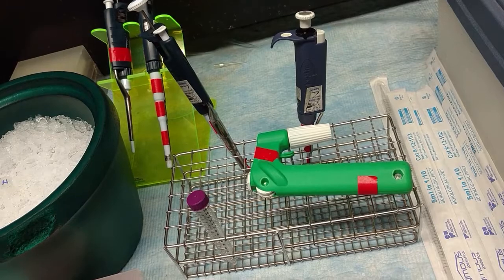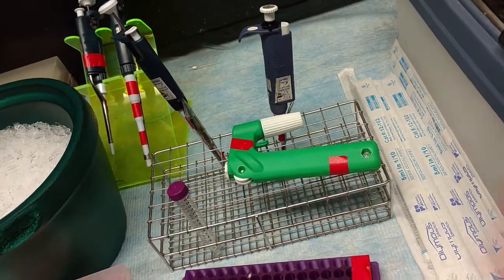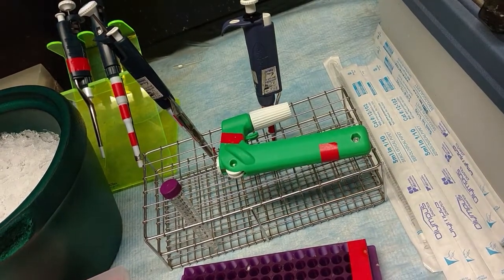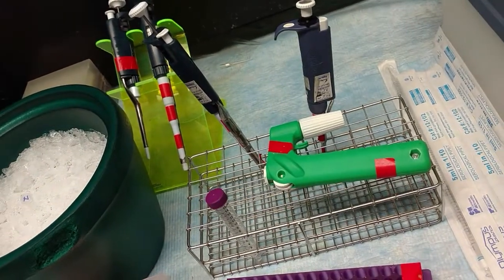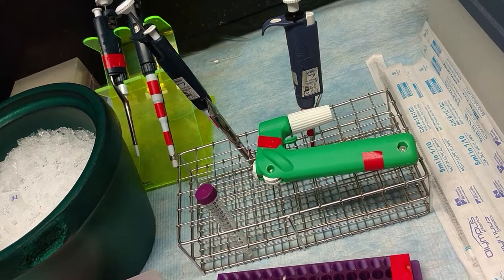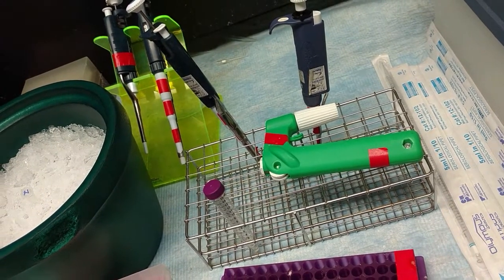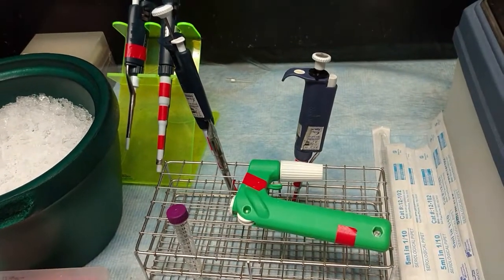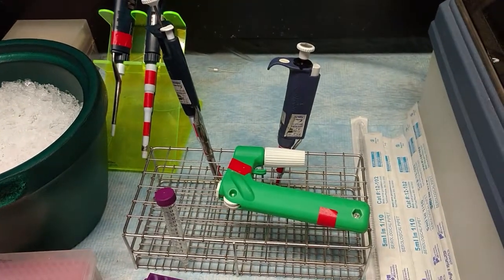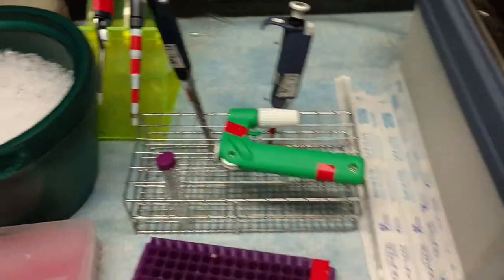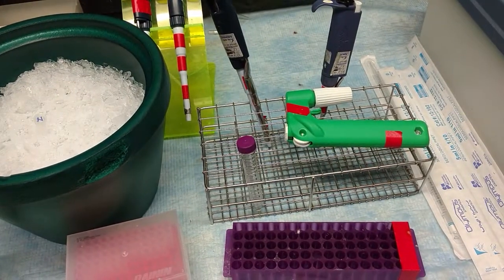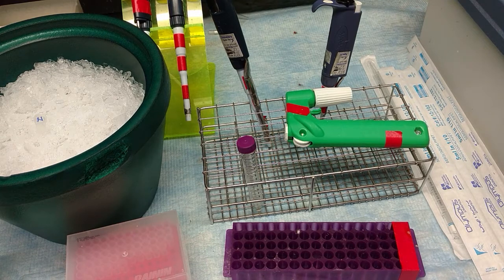We occasionally find items that don't have red tape on them. Don't bring anything into the hood that doesn't have red tape on it because we want to work very hard to prevent DNase contamination outside in the lab, because DNase destroys DNA. Your whole goal here is to isolate DNA and not let your DNA be destroyed.